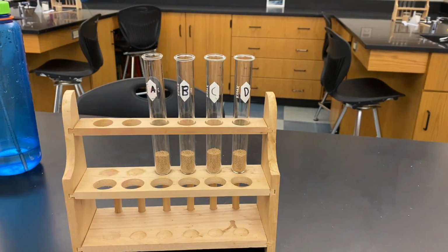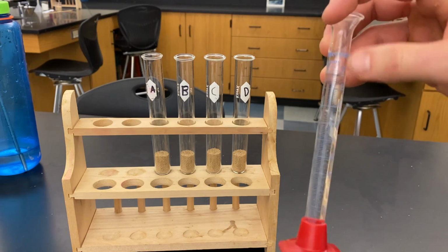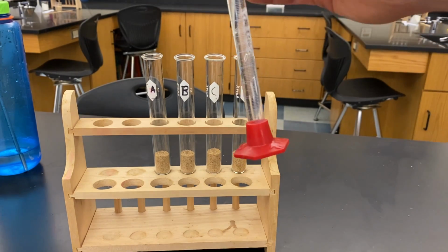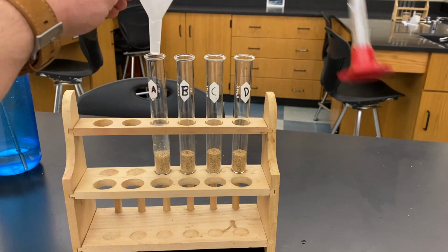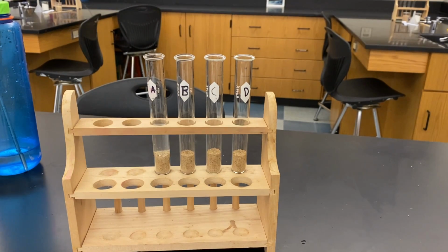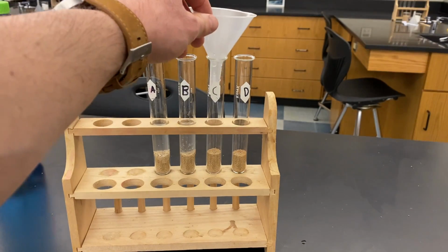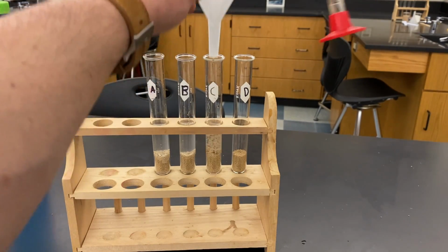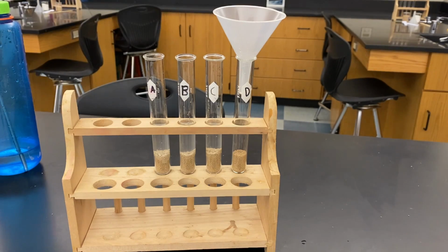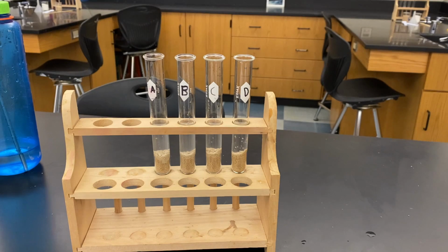Now, in order to get the reaction going, what yeast really likes is water. So you're going to have a graduated cylinder. We're going to fill it up. We're going to have 10 milliliters, no, all the way up top. We're just going to put in 10 milliliters of water in each one. I already have the other ones filled up. You can fill it up each time. And finally, number 4. So they all have water, so we can get a reaction going.